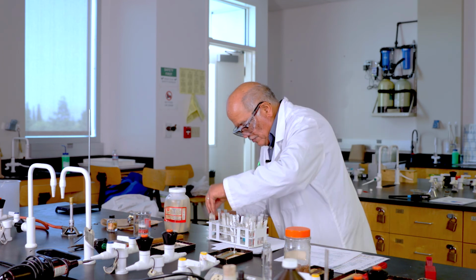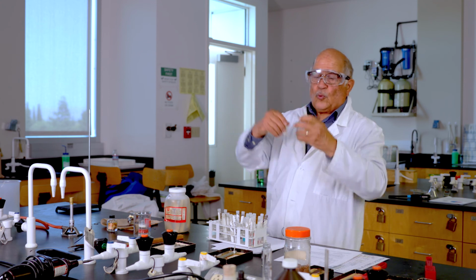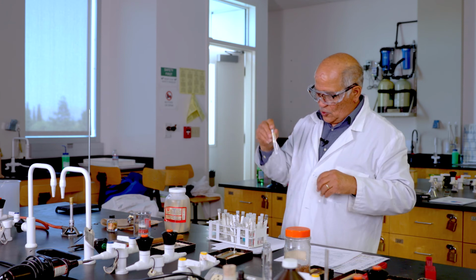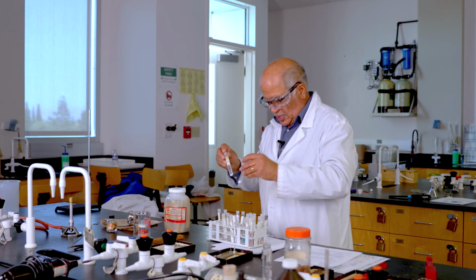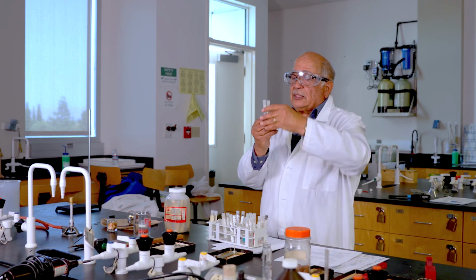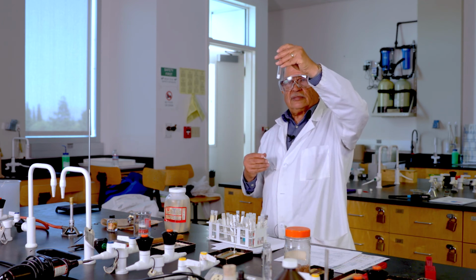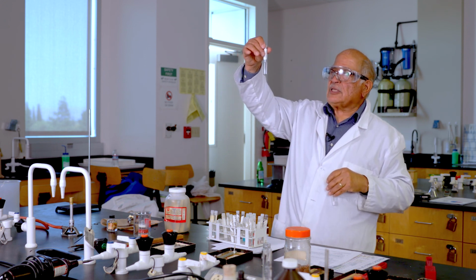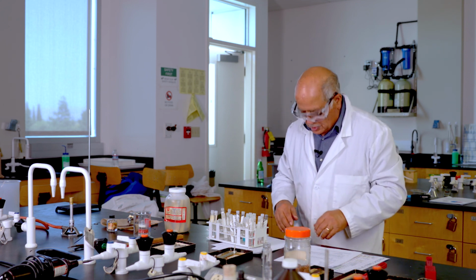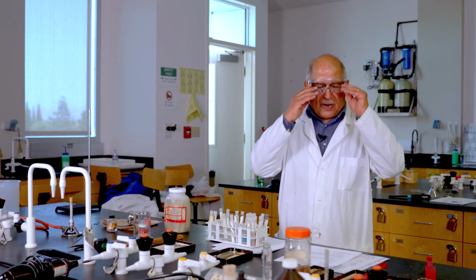I have here a chemical called barium sulfate. Without the water, with the water, it is not soluble either. So this chemical is insoluble, meaning not soluble. I have here zinc sulfate. It's like white crystals. In water, it is completely soluble. So again, you enter that on page 217. That's it for the compounds and the elements.